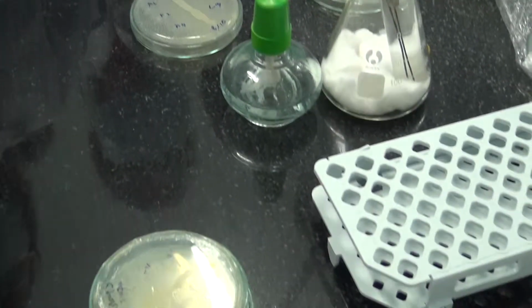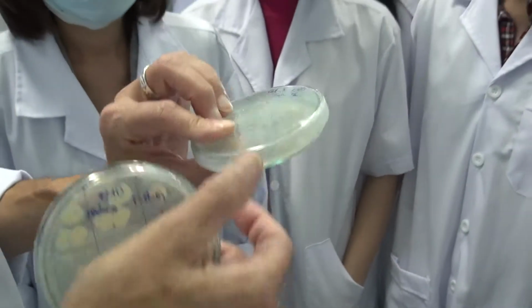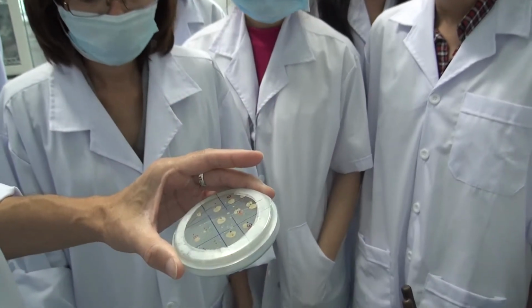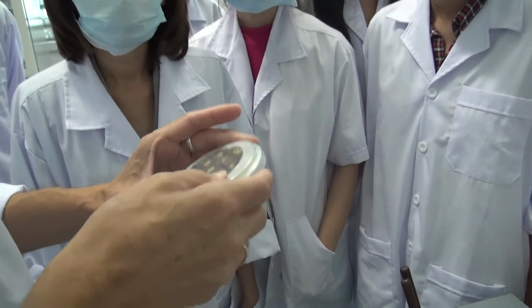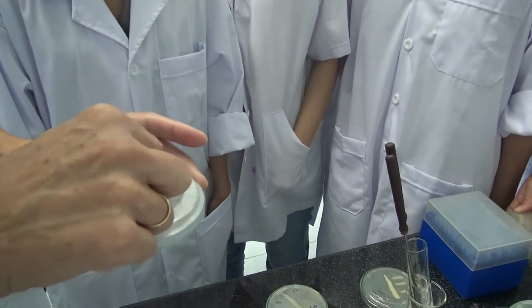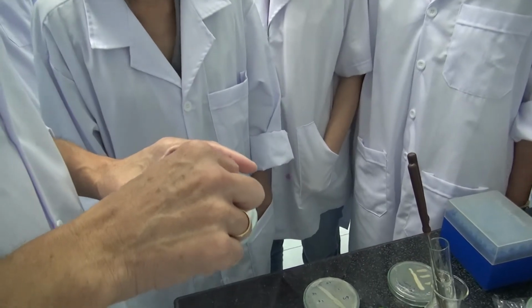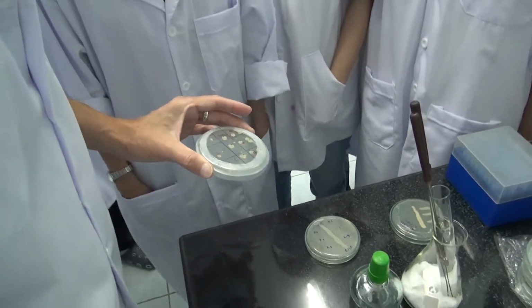Okay? Now here it's going to be more complicated, I think. Okay, wow. Basically, do we have the chart? Yeah. Basically, I think that if you have everything like this, it means there's no interaction. You know, they're growing nicely one next to the other. Okay, you have to be careful.